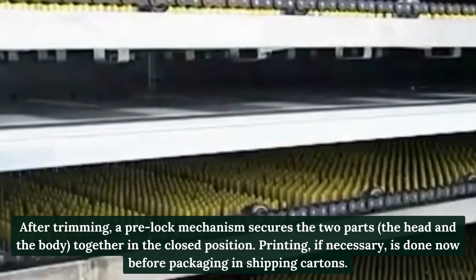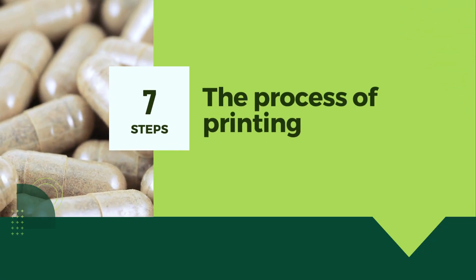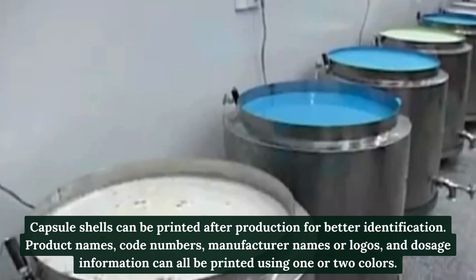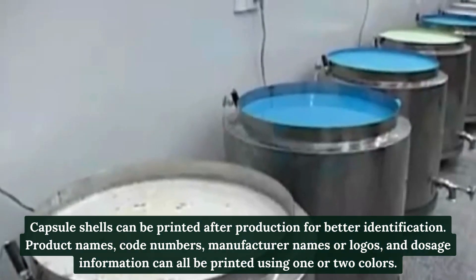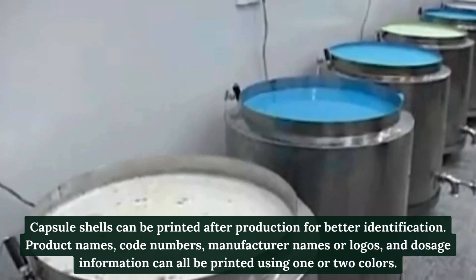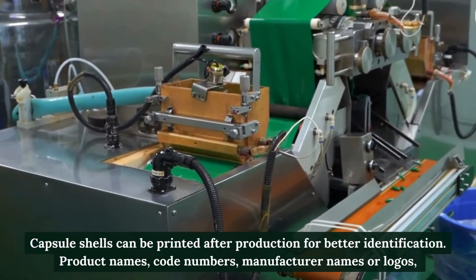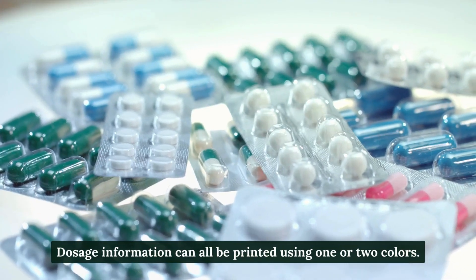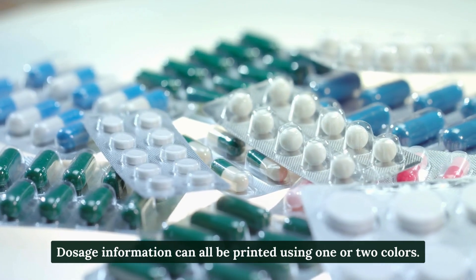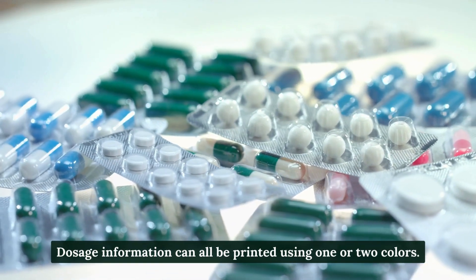Step 7: The process of printing. Capsule shells can be printed after production for better identification. Product names, code numbers, manufacturer names or logos, and dosage information can all be printed using one or two colors.